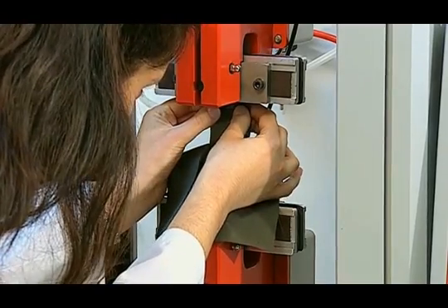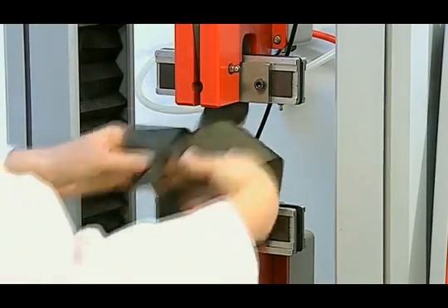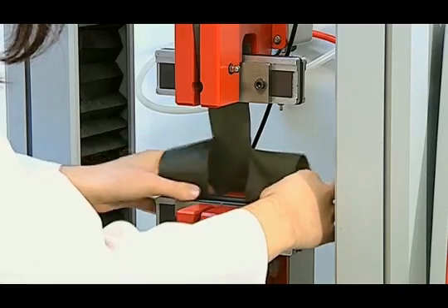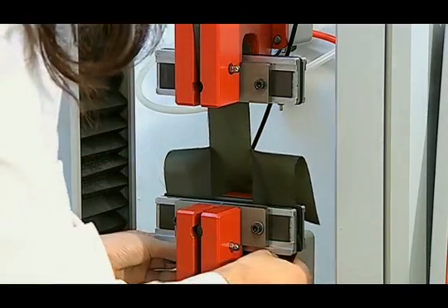When preparing the sample, the section we marked at 70 mm is placed into the upper jaw. The other part is placed in the lower jaw.